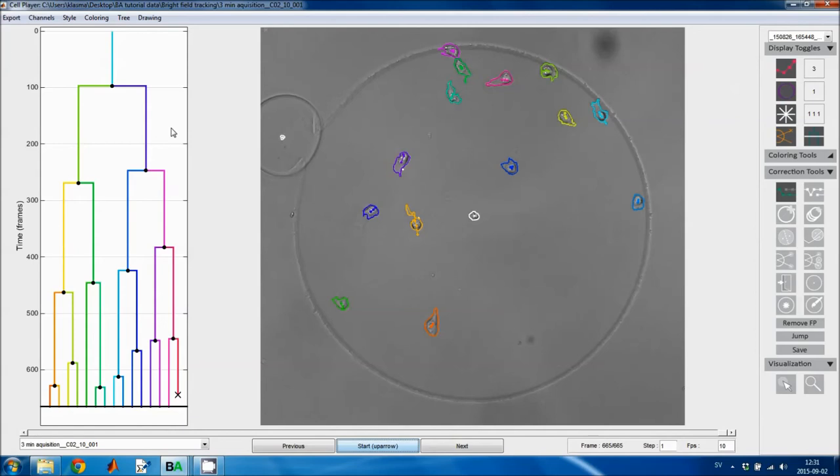The save style is a little bit different. All of the center points have the same appearance, and the outlines are a little bit thicker. This is usually nicer looking if you record a video. And this ISBI option marks the current time point as a circle, so that it doesn't cover small cells. So this is mostly useful if you're tracking particles or small cells.